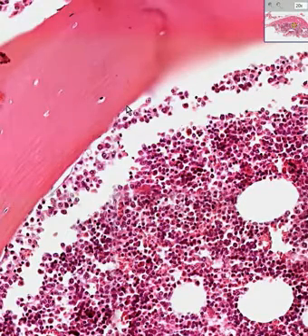So let's take a look at something. We could probably definitely call this cell, this cell, this cell as being osteoblasts. As the bone is formed and they're trapped up within these concentric lines, these osteoblasts, like you see here and here and here, and probably along here, become then osteocytes, just like we saw in Haversian bone also, and very similar to the way we saw chondroblasts at the periphery near the perichondrium become chondrocytes within the middle of the matrix. So this is a much simpler form of bone.